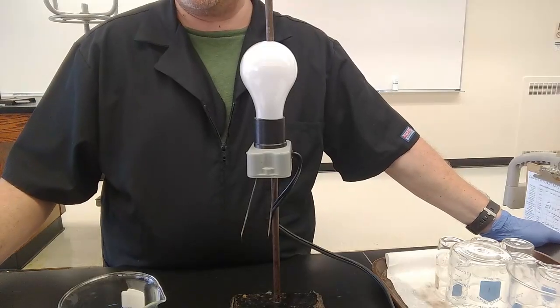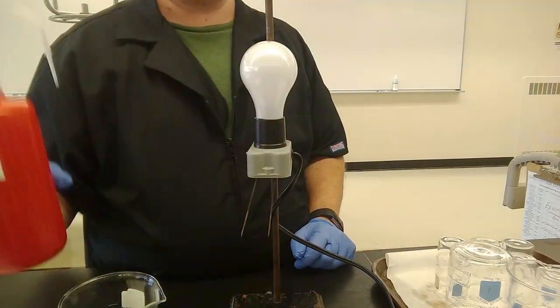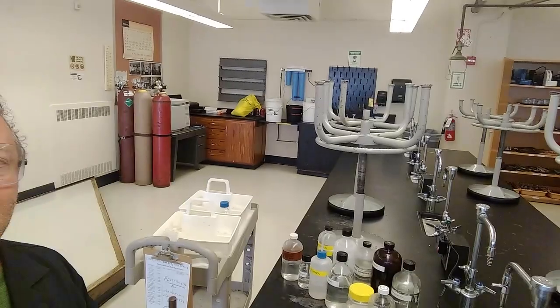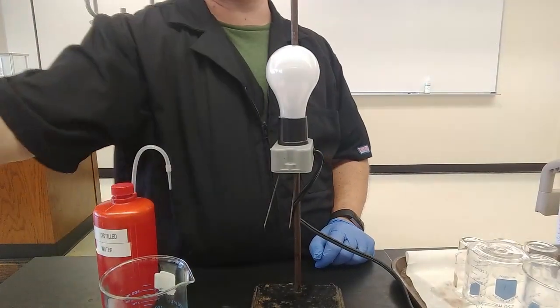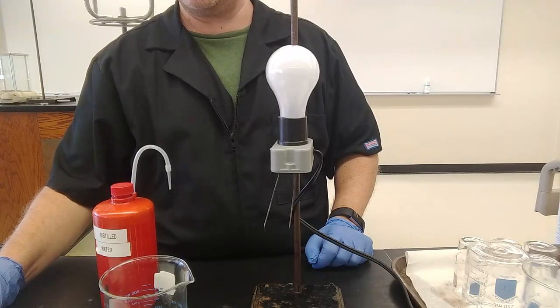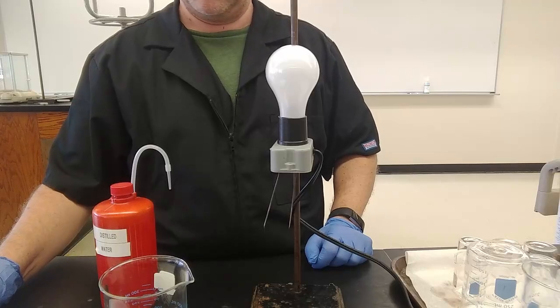All right. So the first thing up on the list is our deionized water. Again, this bottle says distilled water on it, but it is in fact deionized. We have a deionizer. In fact, I think I can get you a shot of it over there on the wall. Those blue canisters take the tap water and deionize it. Now, New York City tap water is pretty darn pristine. If you drive upstate to some of the reservoirs up there, occasionally you'll see an NYPD car passing by or an NYDEP car passing by, because the city of New York owns those upstate reservoirs, much to the consternation of the folks who live near those reservoirs.